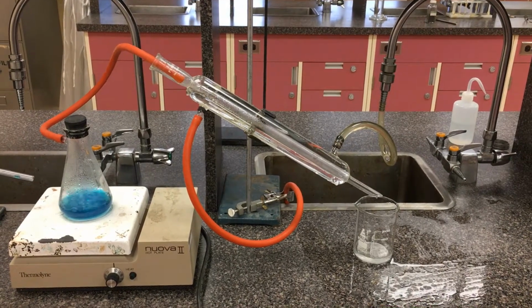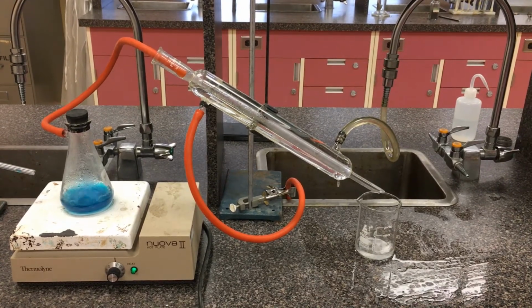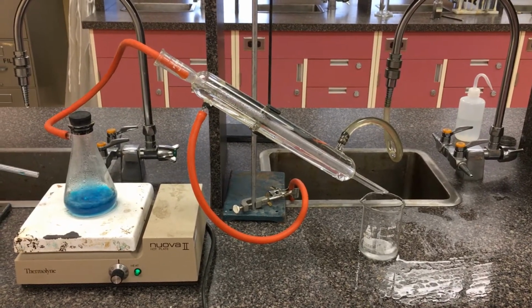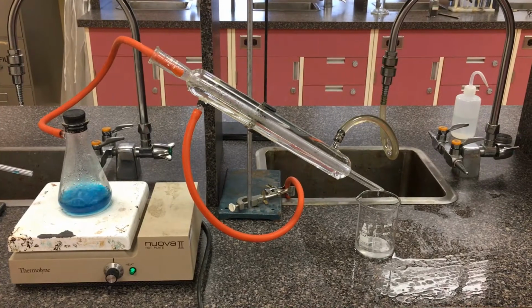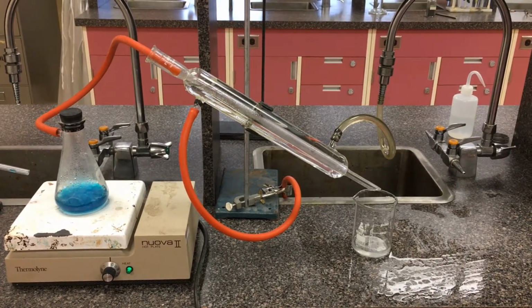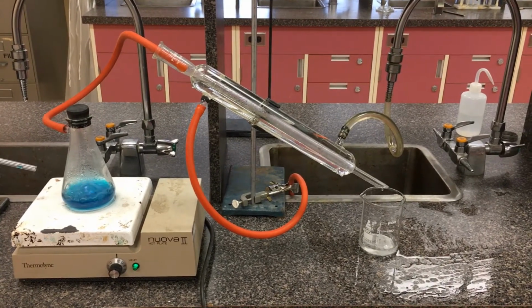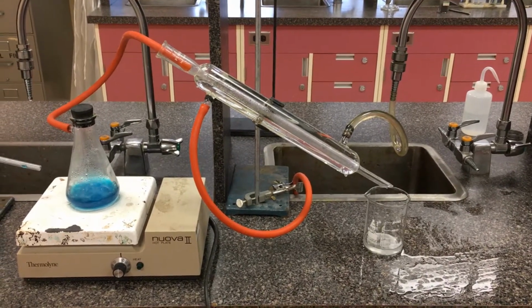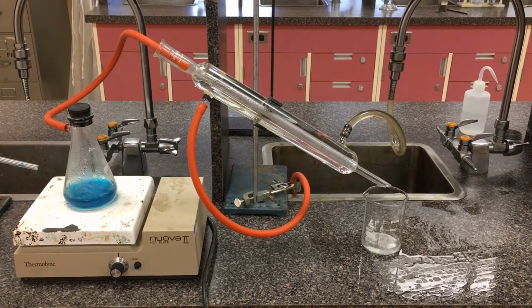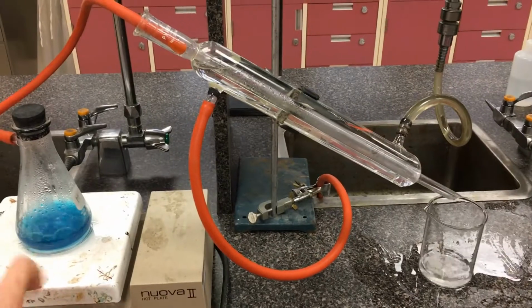Okay, so here's a look at a sample distillation setup. In our organic chapter, we learned how alcohols can be oxidized using various oxidizing agents like potassium permanganate. The one we typically use is acidified dichromate. Depending on the alcohol, whether it's a primary alcohol or secondary alcohol, we can actually oxidize that OH hydroxyl group into other functionalities. Let's imagine here, right now I just have boiling water simulating my alcohol.